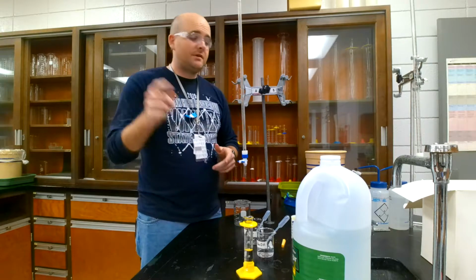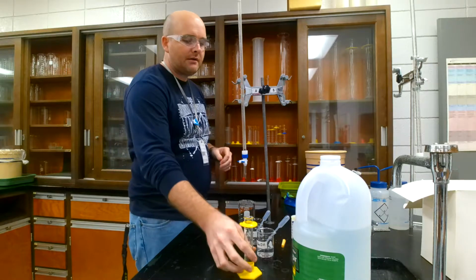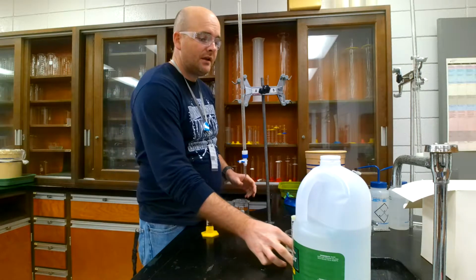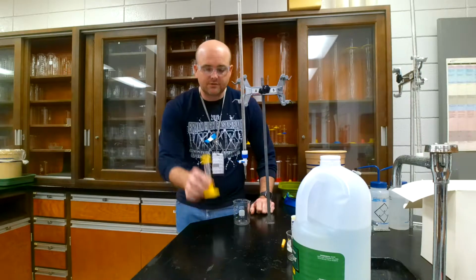Okay, let's do a titration. So here is a general setup that you would have. Now, the purpose of a titration is to determine the concentration of an unknown acid or base. So here is my acid.